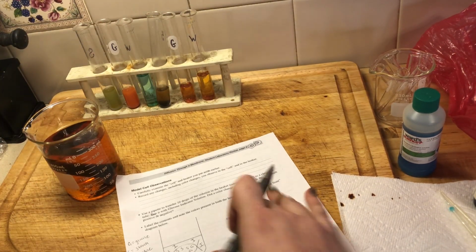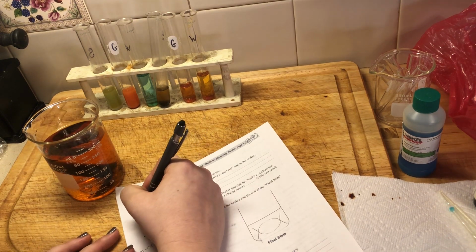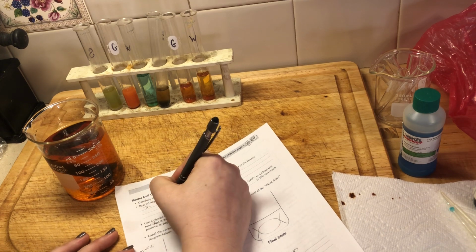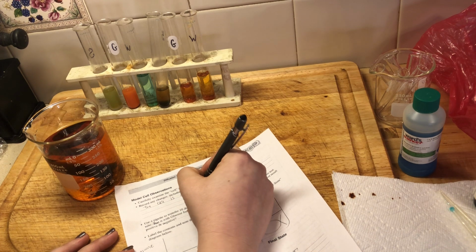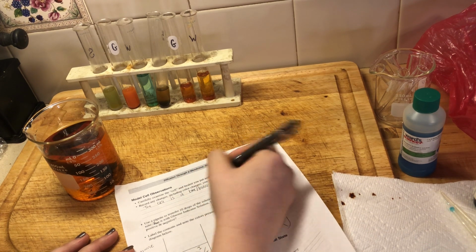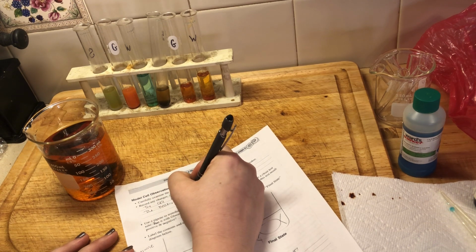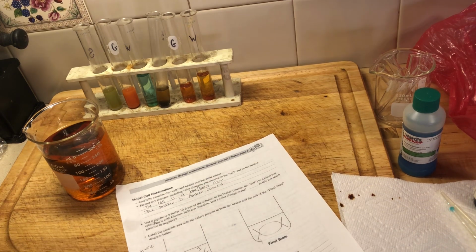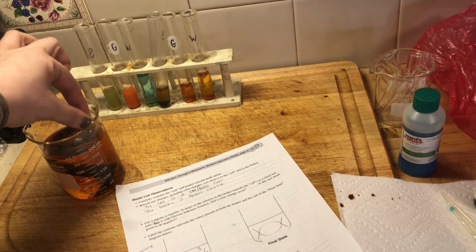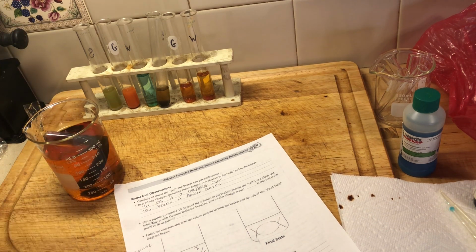So what did we observe here? We're going to record our changes. The cell is blue, and the beaker... okay, so those are basically what we got here, right? The cell turned to a blue-black color, as we can see here. This is not what we started with. And then the beaker is still an amber color. So let's move down on here.